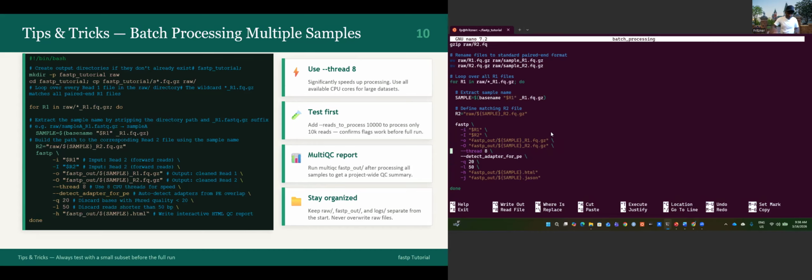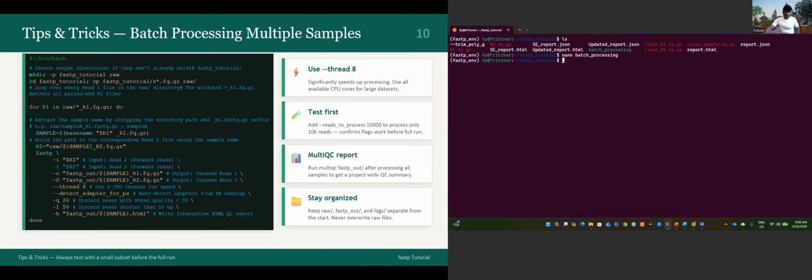Okay, let's try to run it and see if it will work. Because I'm in this directory, if I run it inside this directory, it might be complicated. Let's go home. Now, I know my script name. Okay, let's run it. It is fastp. Sorry, fastp. It's just where the script is and the script name. It should work.